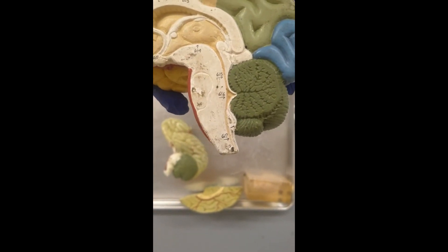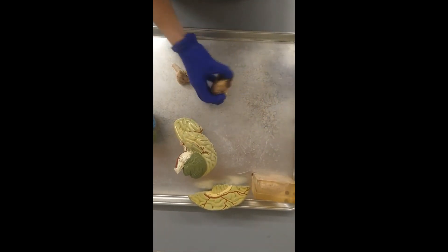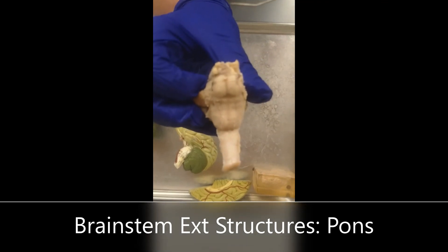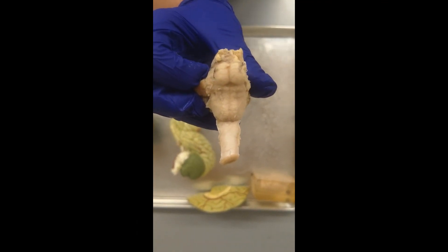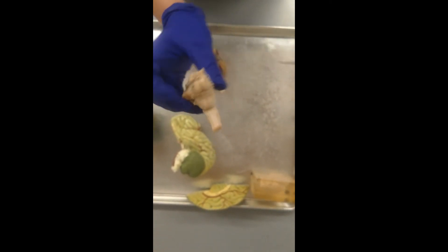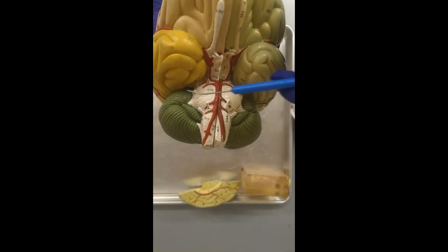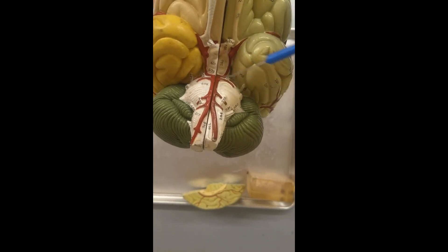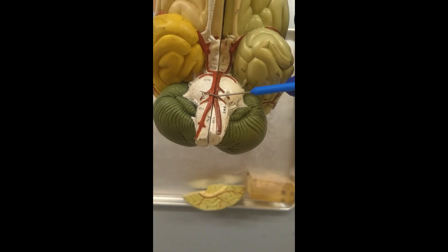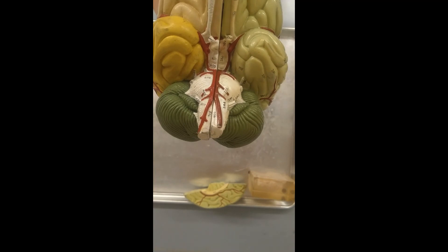That's the midbrain. Then we move on to the pons. On the plastic model, this really big bulge right here is going to be the pons. There is going to be a lot of bridging of pathways going on in the pons — that's actually how pons gets its name, from all the bridging of pathways that happen here.